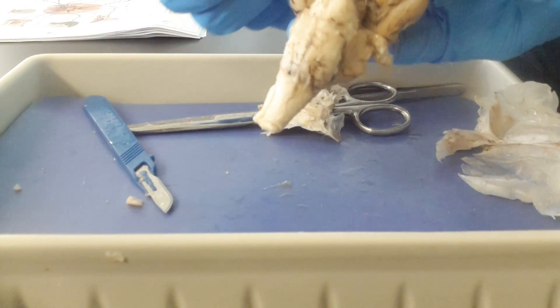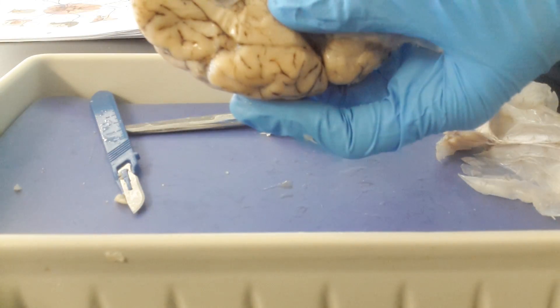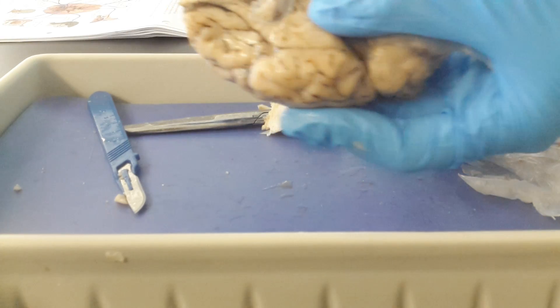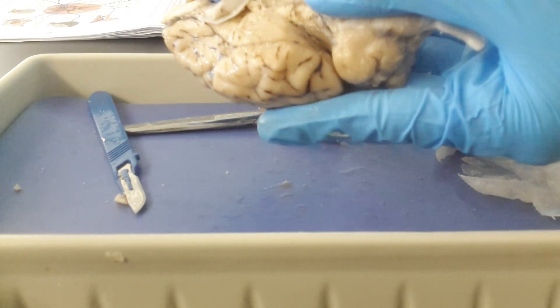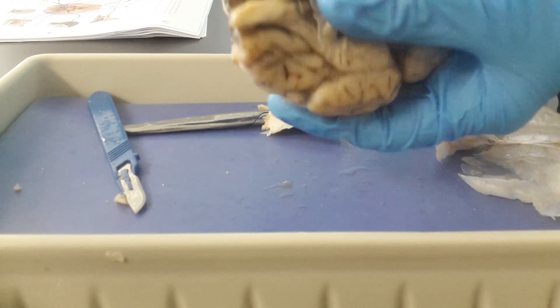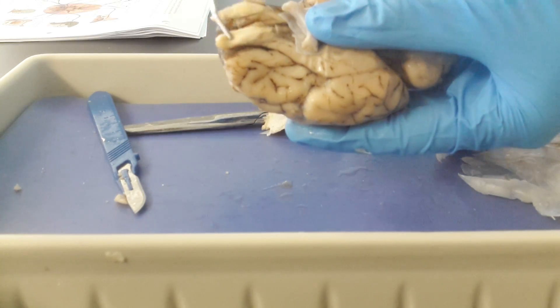Right above the pons, we have the midbrain. If you look right up in this region here, we see these nerves right here are the optic nerves, and the optic nerves connect to the brain right here at the optic chiasm. Up here, we have the olfactory bulbs right here and right here, and these are the olfactory tracts.